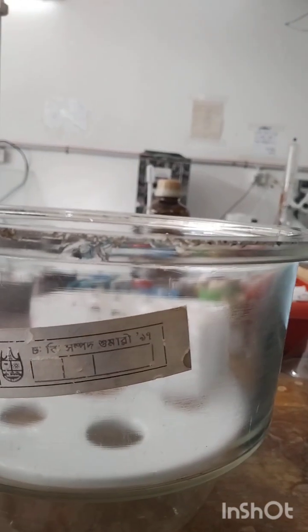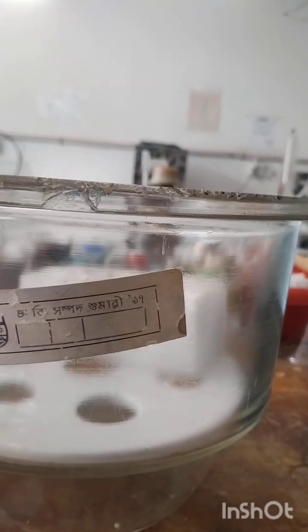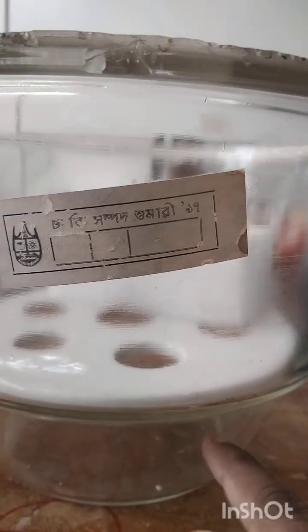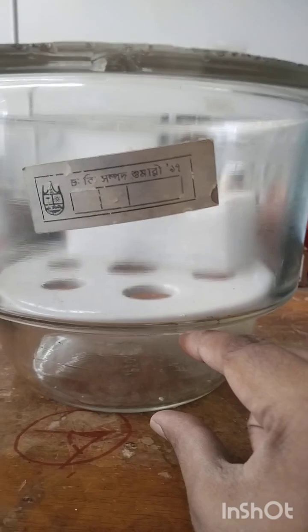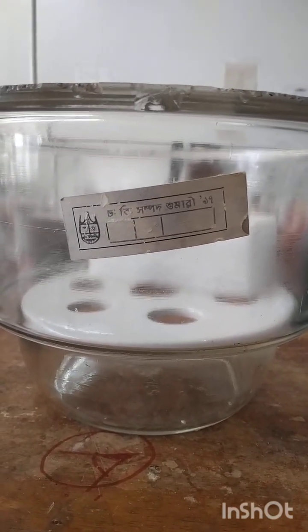And the next one, I would like to say some usage guide. First of all, you have to prepare the desiccator and ensure the desiccant is dry and active, and place it evenly in the bottom compartment. Evenly means that the placing of desiccant or dehydrating material in this lower compartment will be even. There is no kind of uneven state or uneven form.